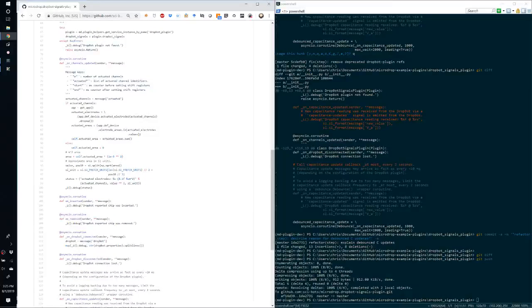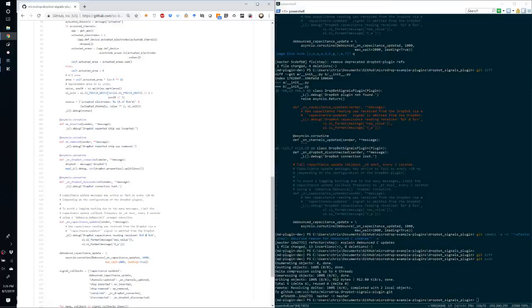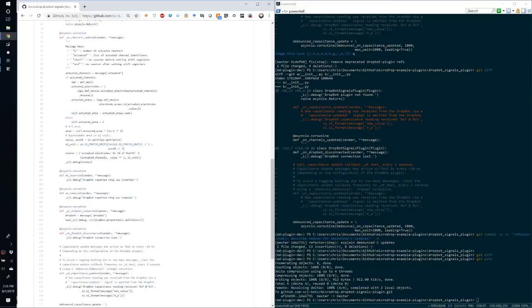So the rest of the implementation of this method is a series of callback coroutines. You notice that it's an asyncio coroutine. So we have one for on channels updated, we have one for on inserted, on removed, on DropBot connected, and on DropBot disconnected. Now all of these are simply logging a message.